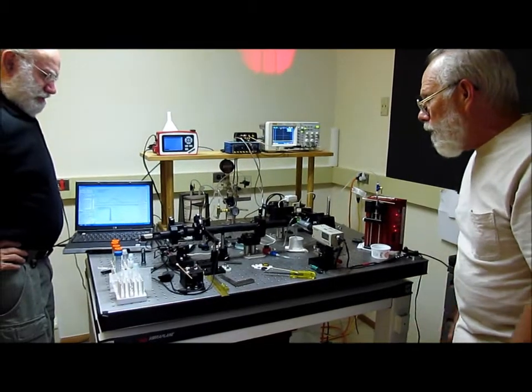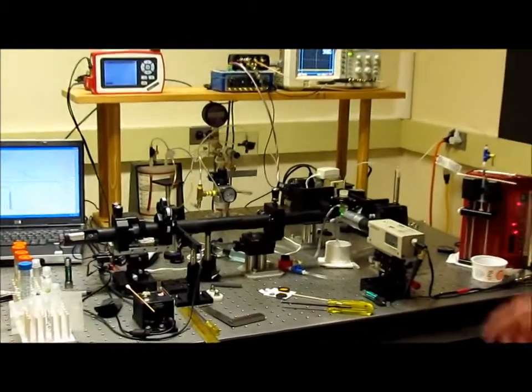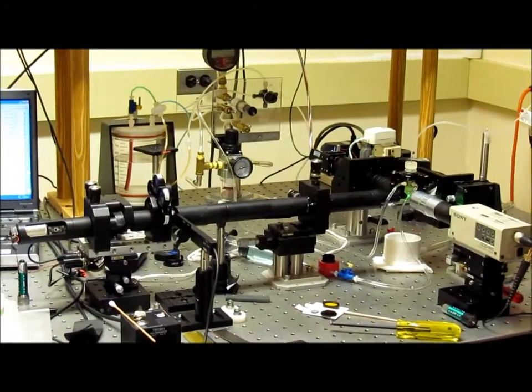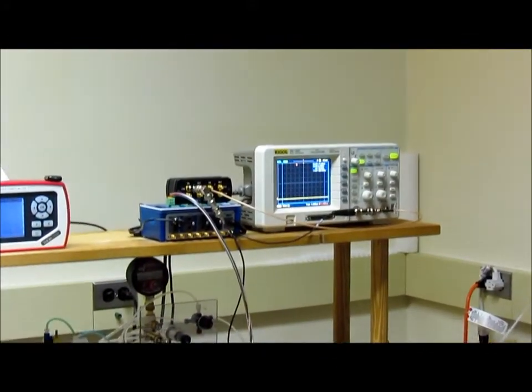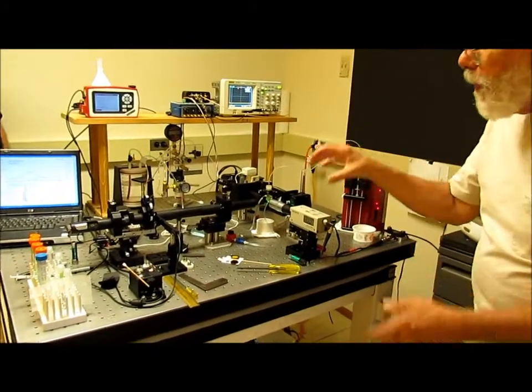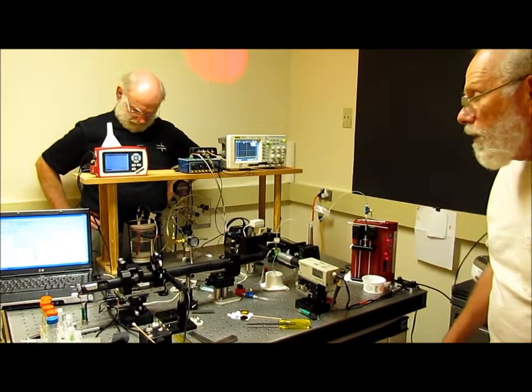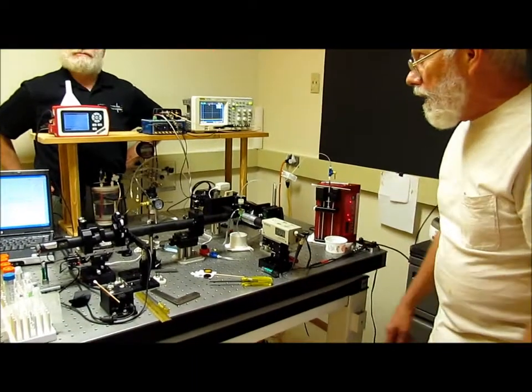designed for educational purposes. The system you see here is a fairly simple flow cytometer, and in the laboratory course sessions that we teach, we start out with the table essentially clear, and each of the modules that go into assembling this system is then sequentially put in place by the students, and over a time period of about 3.5 hours. At the end of that time period, they have an operating system that will look like what we're seeing here today.